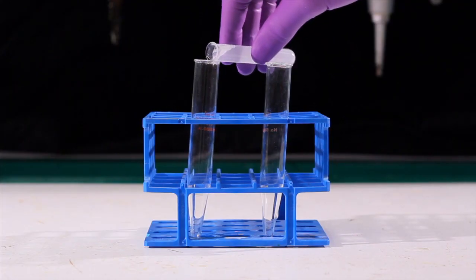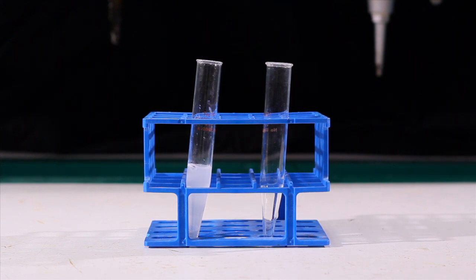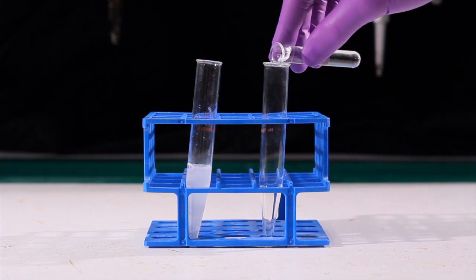Because of the high forces involved, special centrifuge tubes must be used. Place your samples into an appropriate volume tube, never fill the tube more than three quarters full.